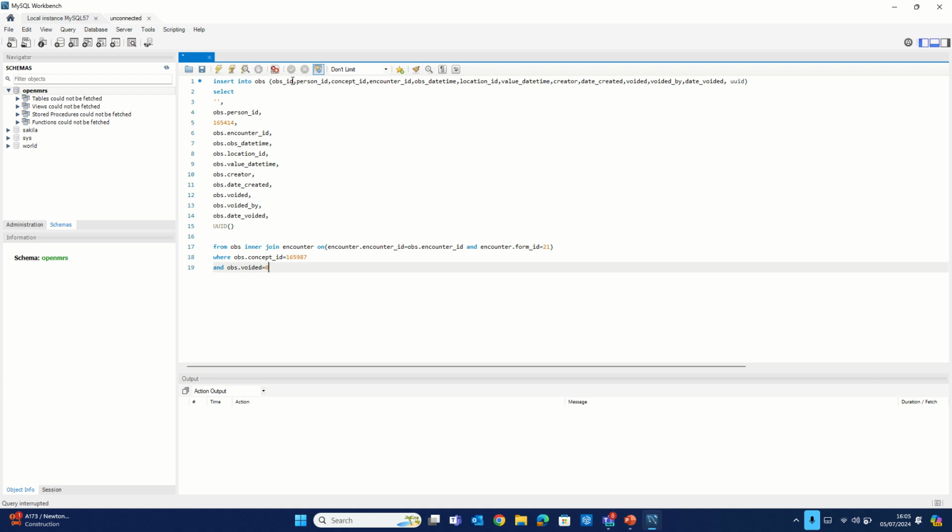Once that is done, you can go ahead to do your entries and do your updates and every other thing you need to do as usual. And then perhaps at the end of it all, you generate your ART line list and share as is expected. So that's all you need to do.